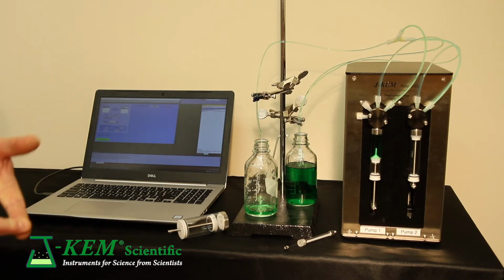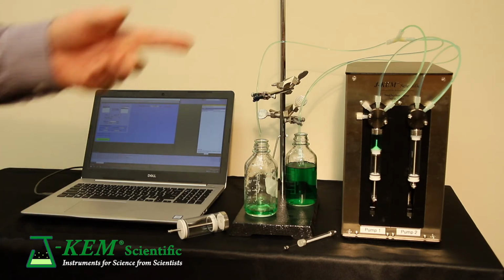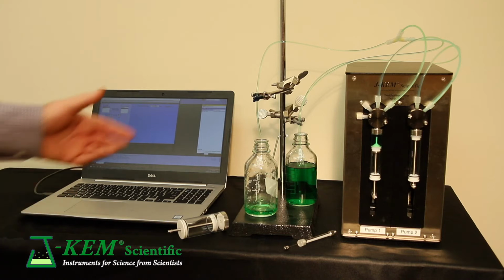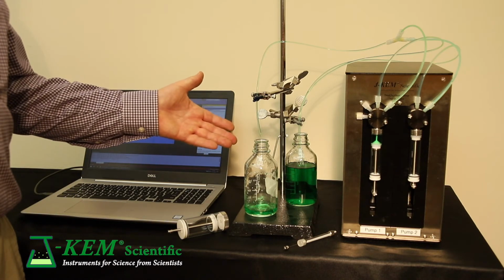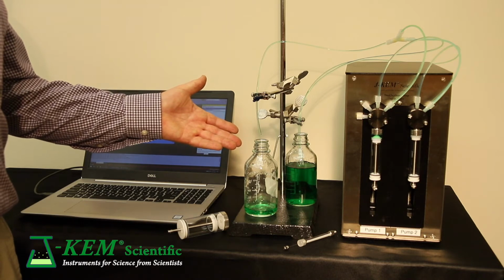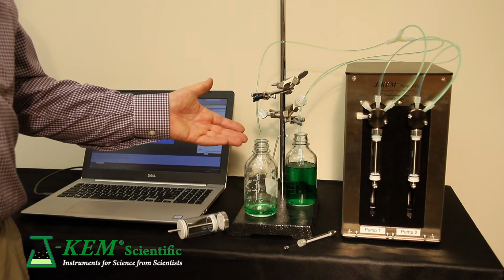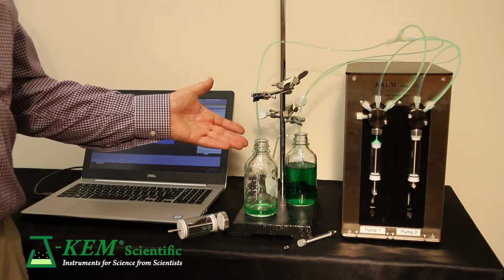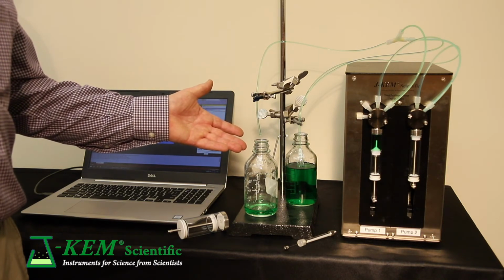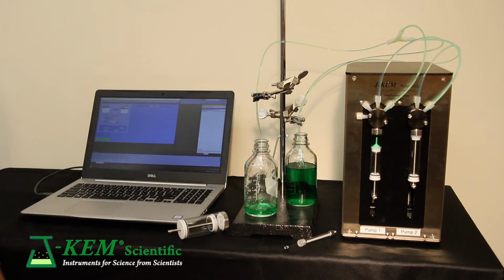So the first one is all the pump systems automatically refill, so you can deliver any volume from any system. But watch what happens when it needs to refill again. Right now it is dispensing at the requested rate of 10 milliliters a minute. But when it needs to refill, the dispense will stop. It has to, because there's only one syringe. Once it's full, it will resume its delivery.